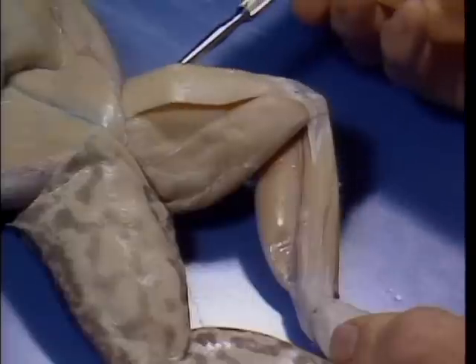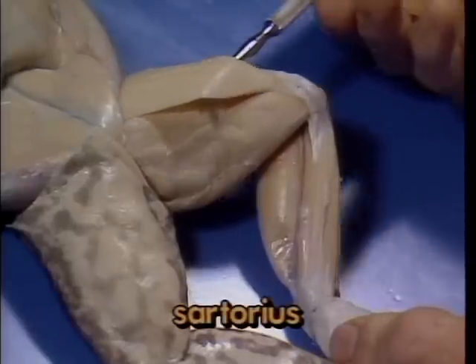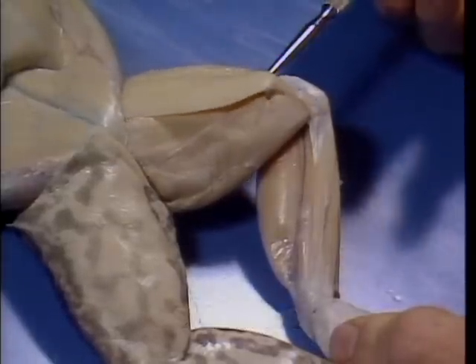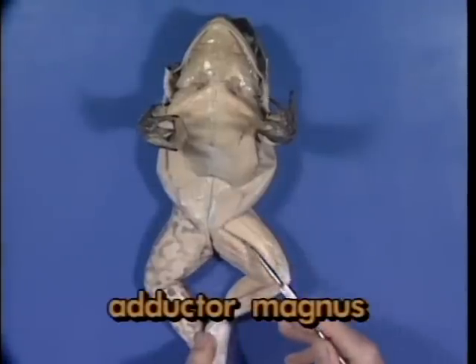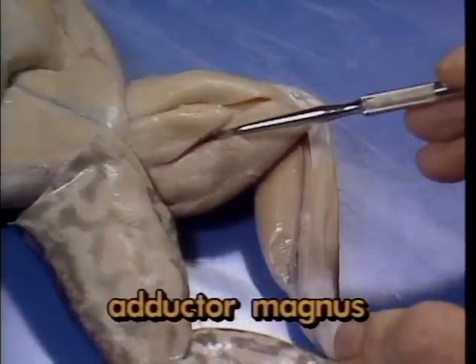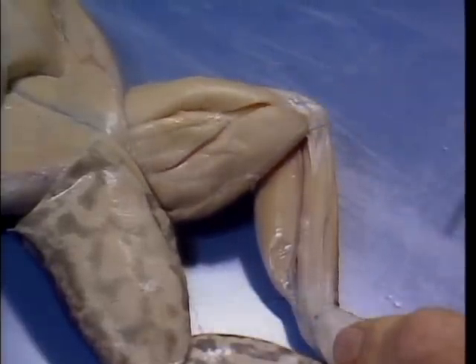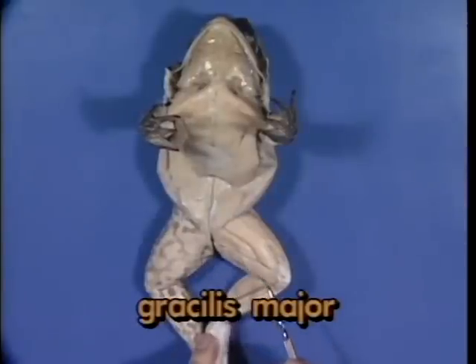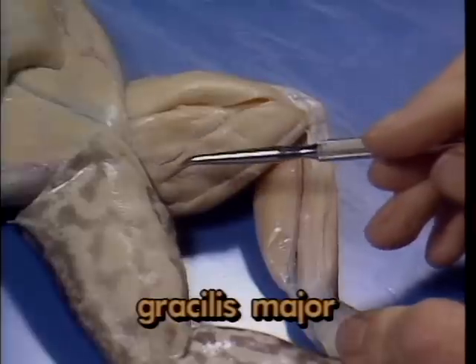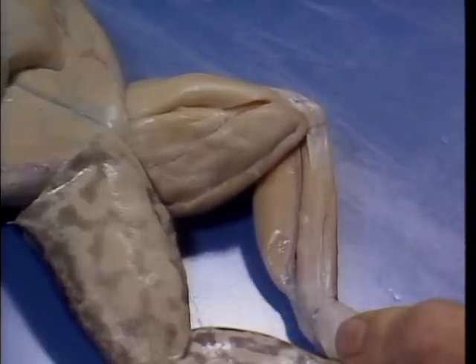Medial to the adductor longus is the sartorius. It helps flex the shank and adduct the entire hind limb. The adductor magnus, the small triangular-shaped muscle medial to the sartorius, also helps adduct the hind limb. The gracilis major is the large, thick muscle occupying the medial surface of the thigh. Its action extends the thigh and helps flex the knee.